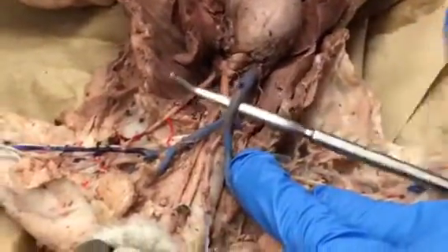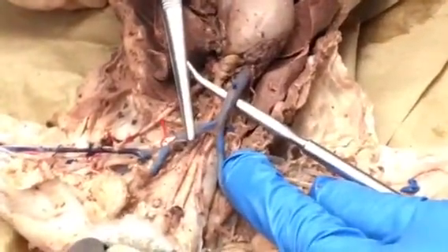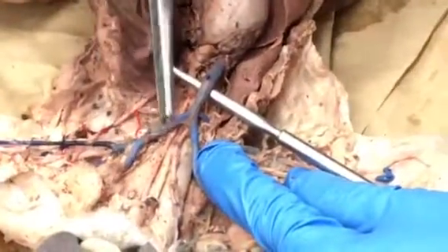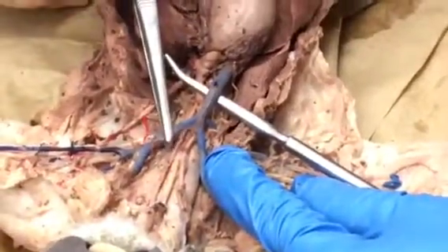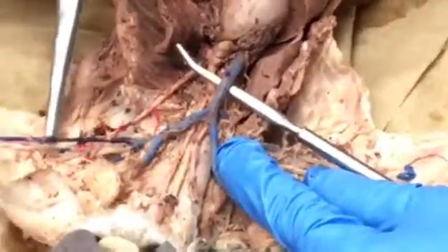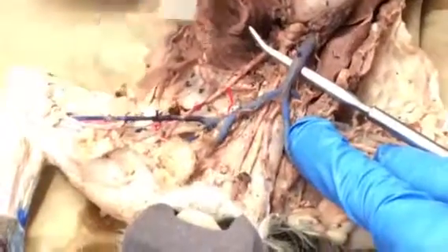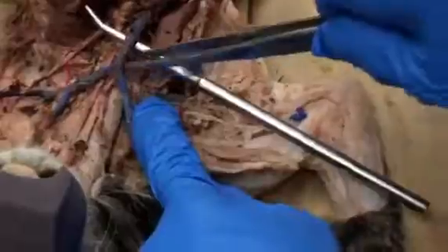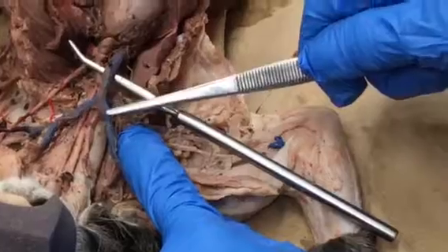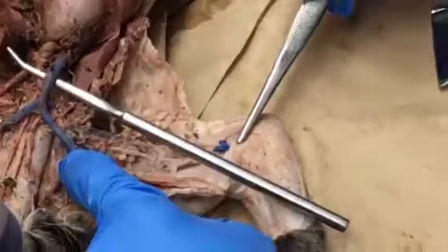It's going to come up here, and it's going to branch left as the left brachiocephalic vein. See that vessel that goes up into the head? We don't need to know what that is, but after that vessel, it goes from being the left brachiocephalic vein to the left subclavian vein. Then in the armpit area, it's the left axillary vein. Farther down in the arm, it's the left brachial vein. And it does the same thing on the right, but I'm going to have to fake it. So we've got superior vena cava, left brachiocephalic vein, left subclavian vein, left axillary vein, left brachial vein.